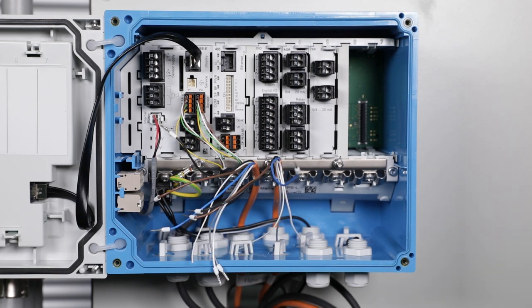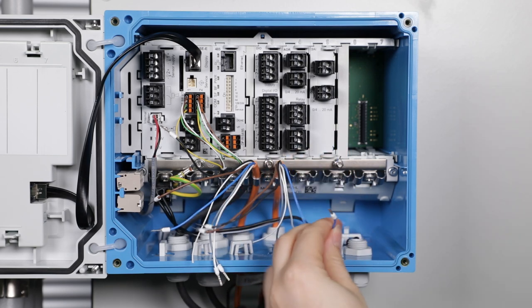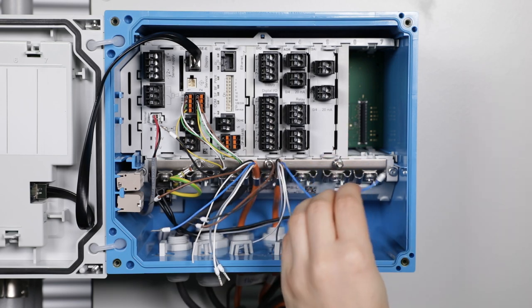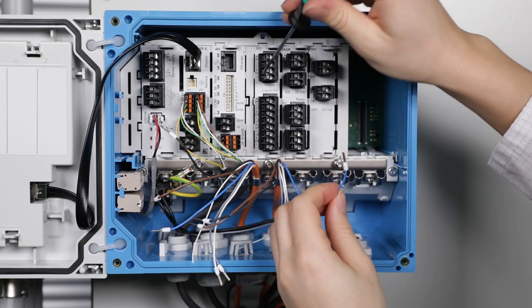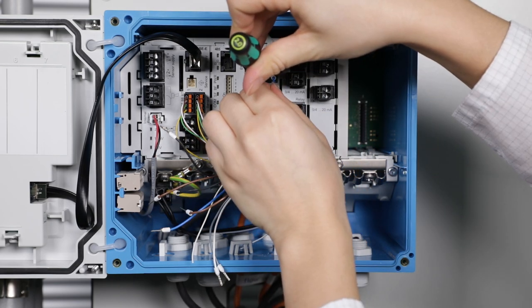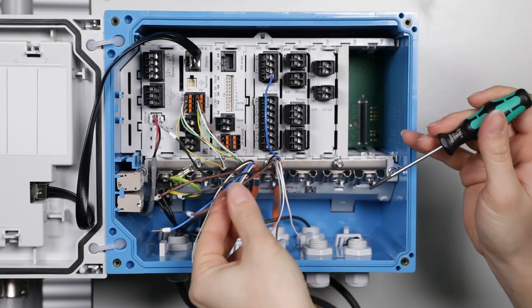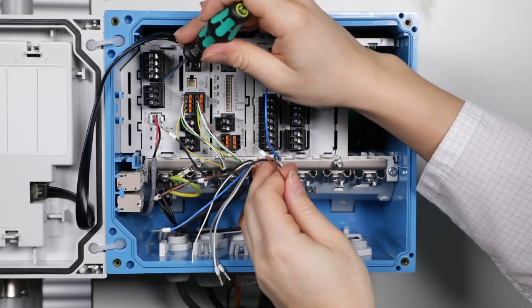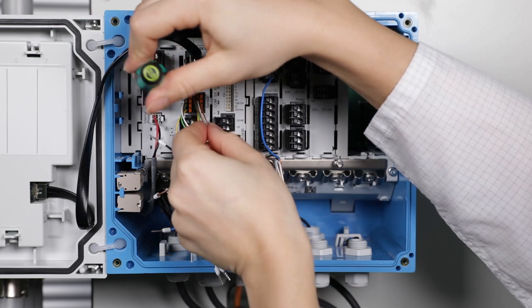Now wire the cables according to the wiring diagram in the operating manual. I start with the cable of the status light. The blue cable is connected to the power supply of the DIO module. The brown and the black cable are connected to the alarm relay.